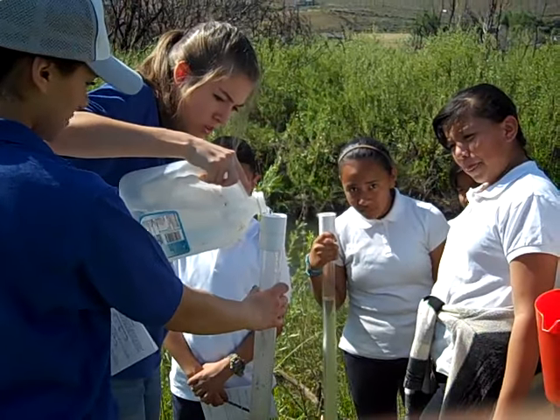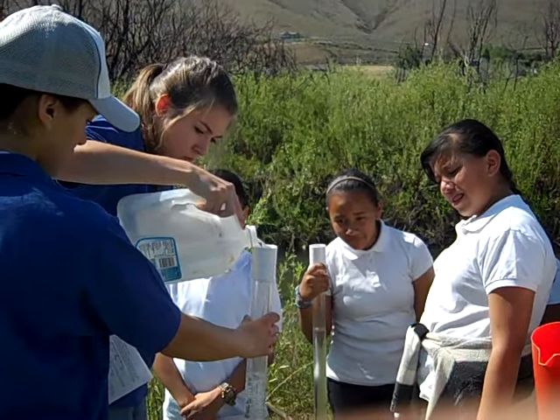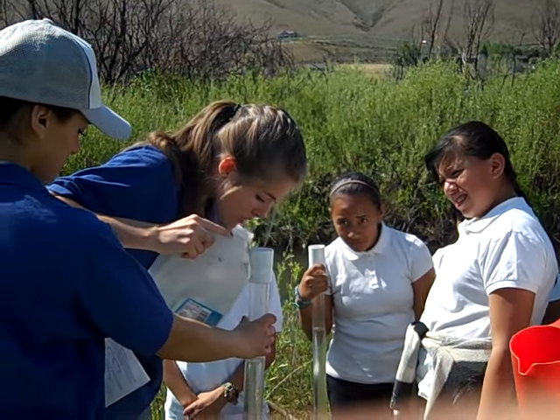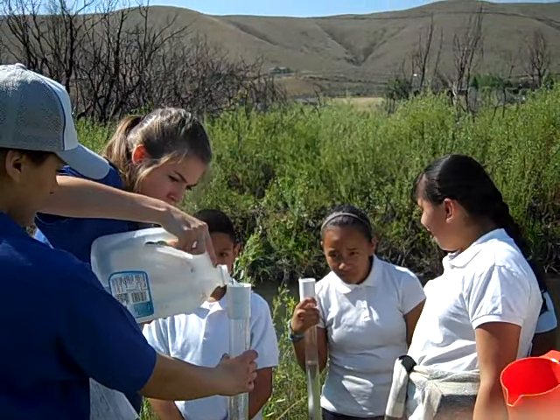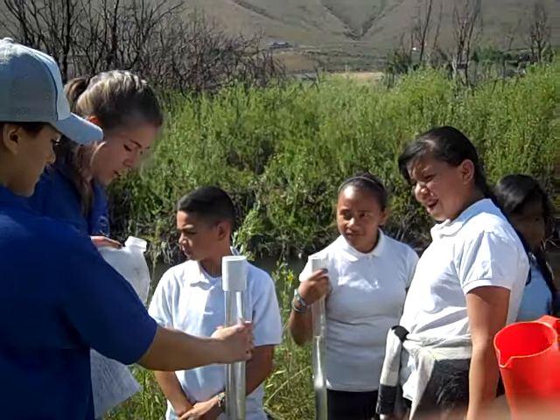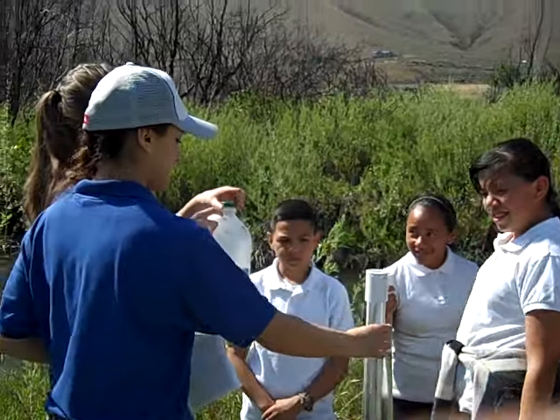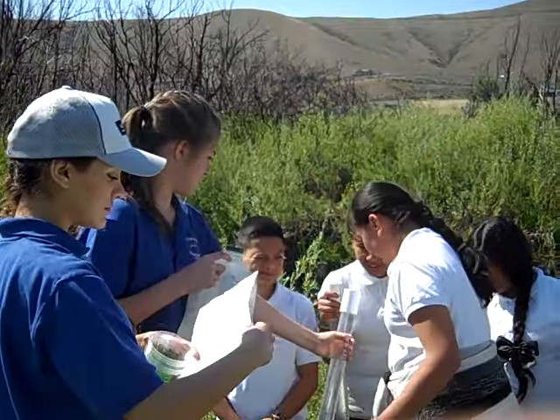Still see it. So we ended up going pretty much to the top, and I can still see it. That kind of tells you how this is tap water. This is out of your sink. You guys can look in there. You see that's still pretty clear.